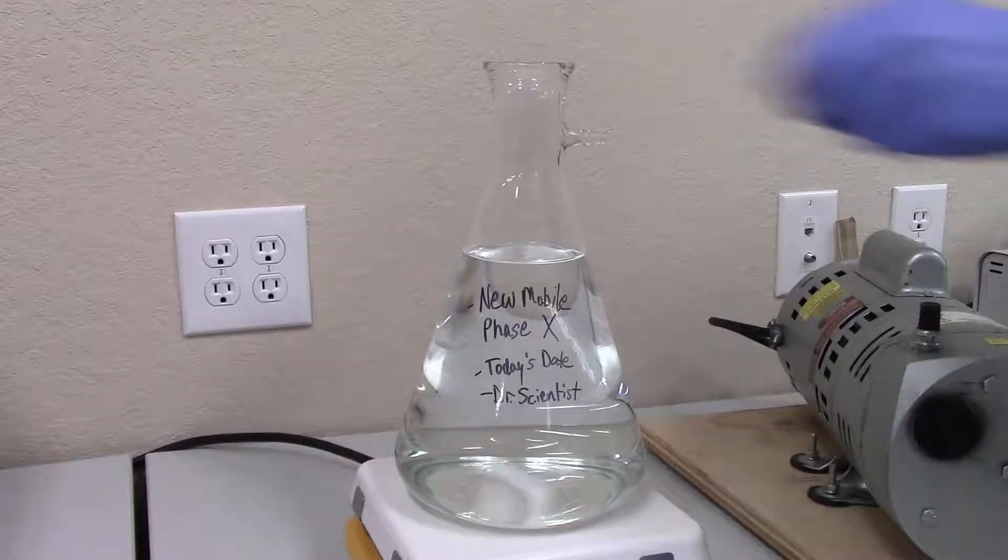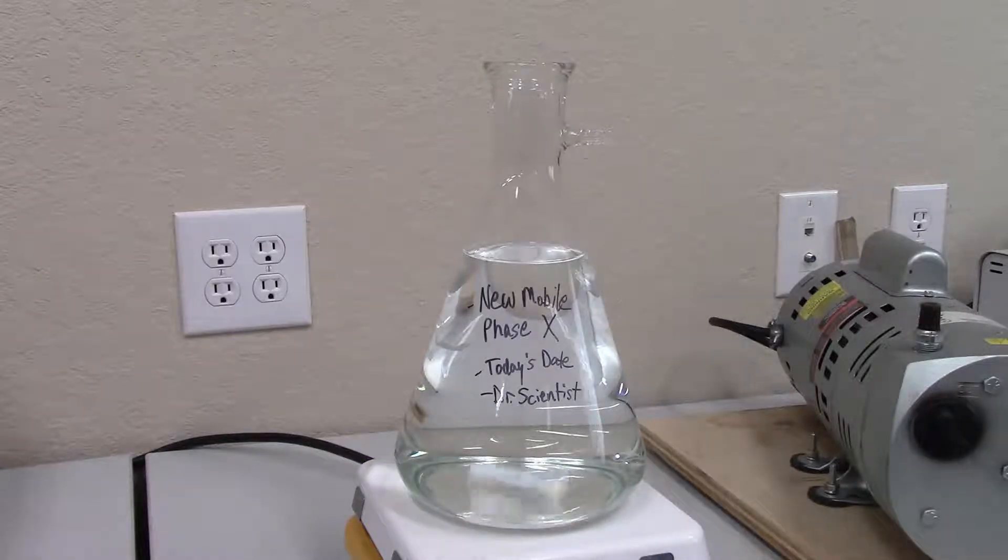Congratulations! Your freshly filtered mobile phase is now ready to be used on your GPC-SEC system.